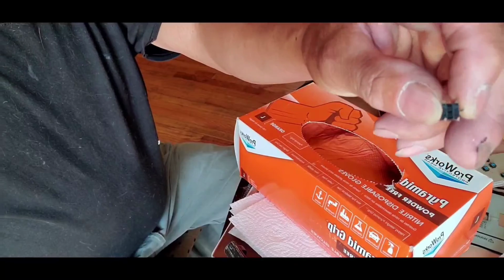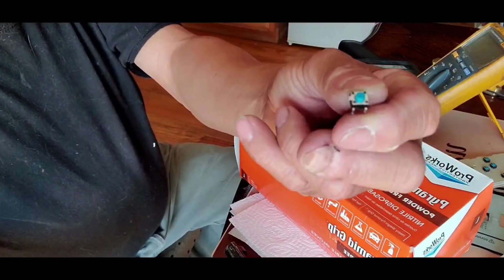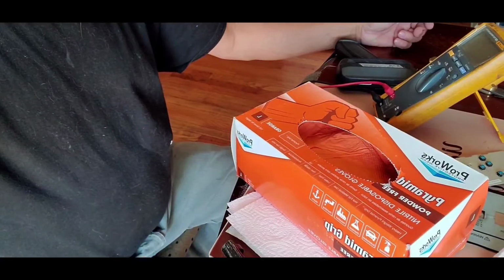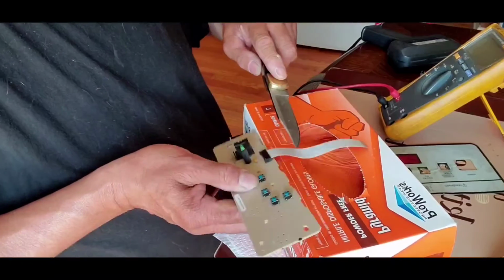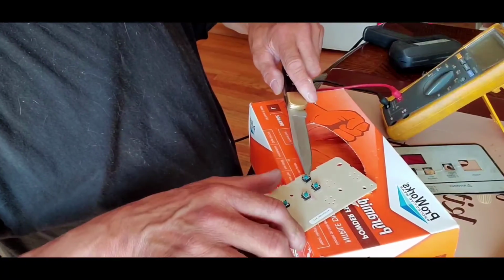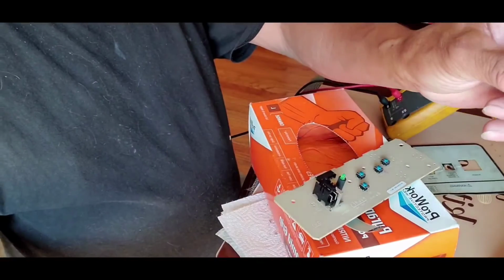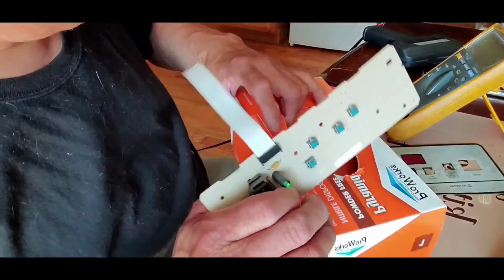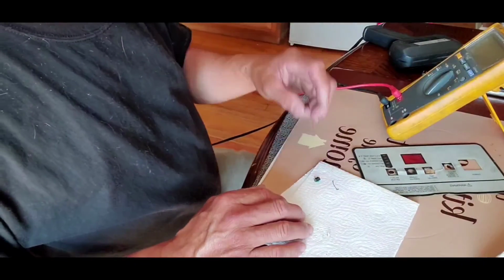Okay folks, this is the second switch that I got. Now I'm gonna continue doing it. There are 2 more left that I need to do. Okay, this is the 3rd switch. Alright, here it is. 4th switch. I'm gonna put this away and test the switch.